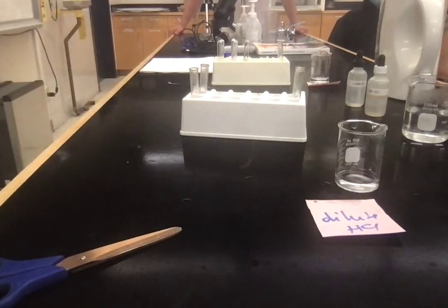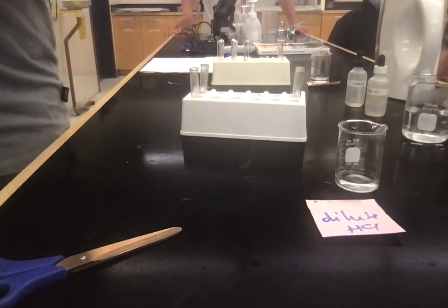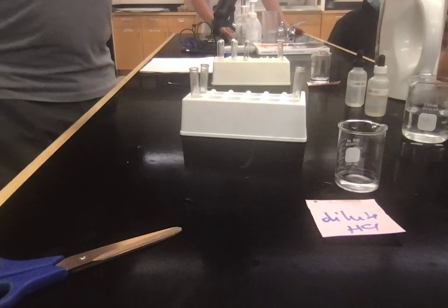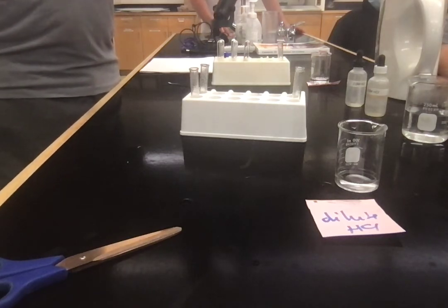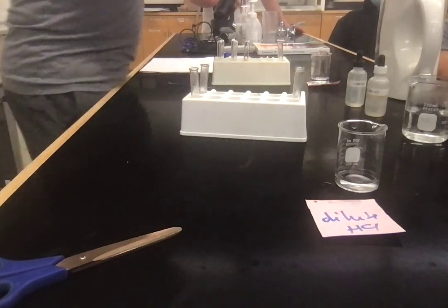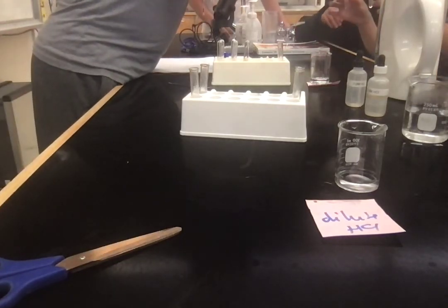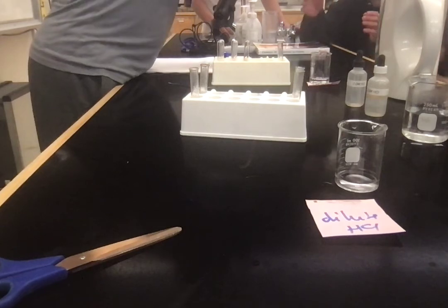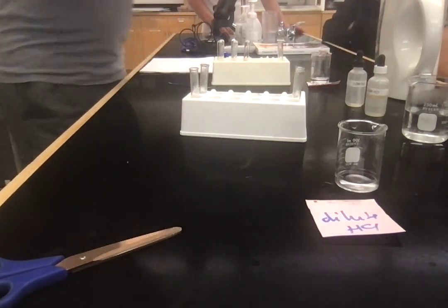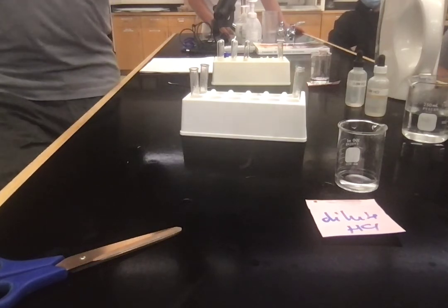Tate? Now it's hot. This one is not as hot. Nick, you did the ones before. Can you tell me if this is as hot or not as hot as the previous? I would say it's not as hot. Right. So this is not as hot as the super concentrated one. But there's definitely a difference between those. Yeah? Good job, Nick. Oh, it's not super hot. But there's a difference. Okay? So these guys are saying there's a difference. We can see a little.